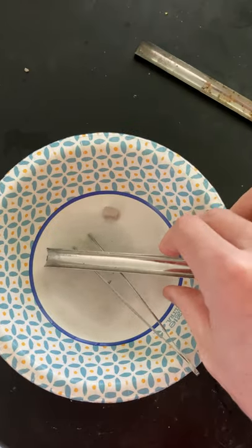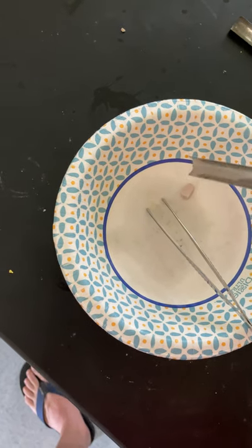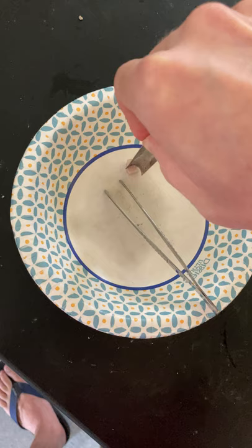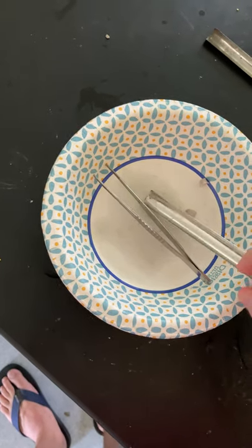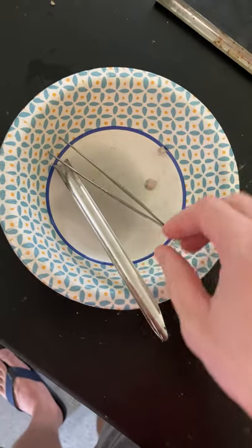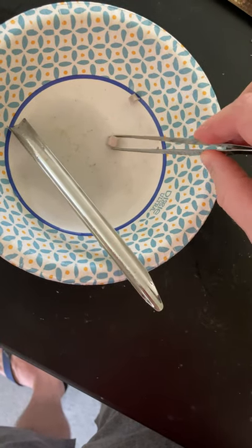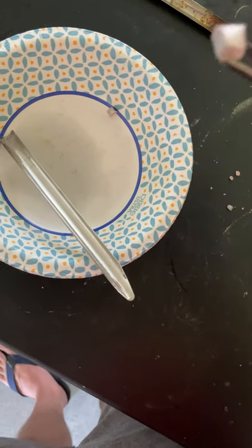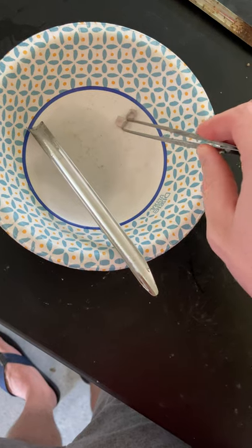This is sodium, and sodium is this kind of light grayish metallic substance. It looks like a cube — kind of pinkish grayish — and if I cut it, the surface is shiny and metallic, but it forms that gray oxide with the air fairly quickly.